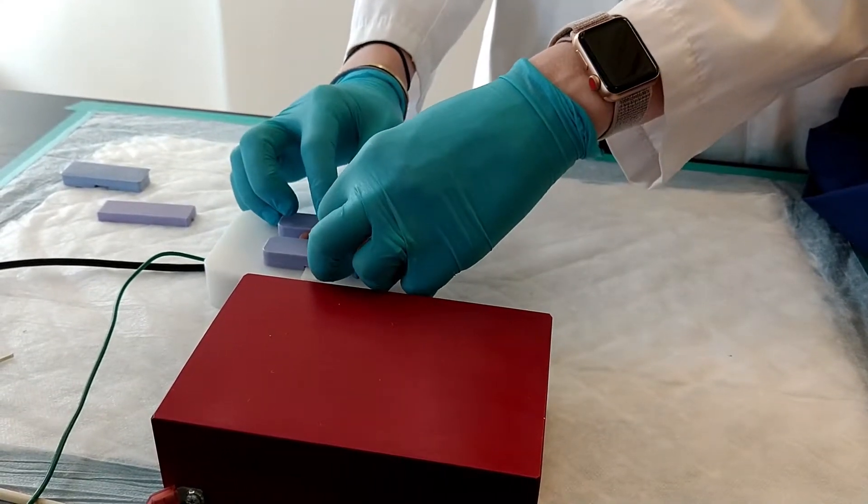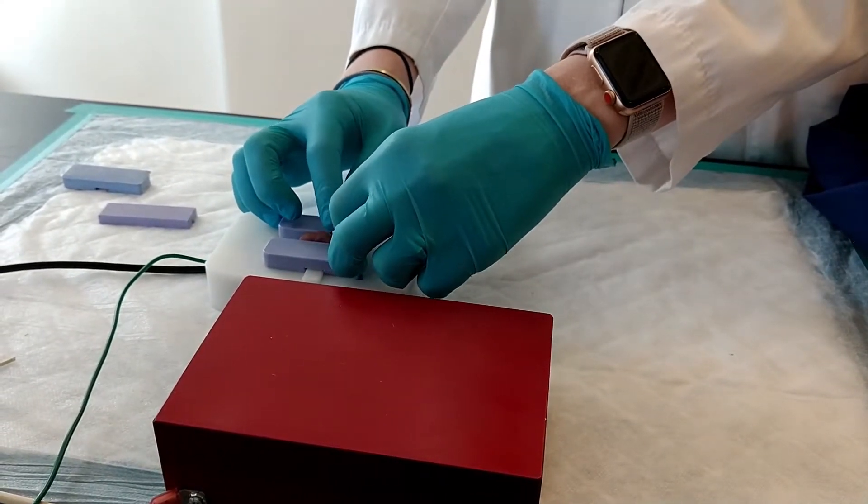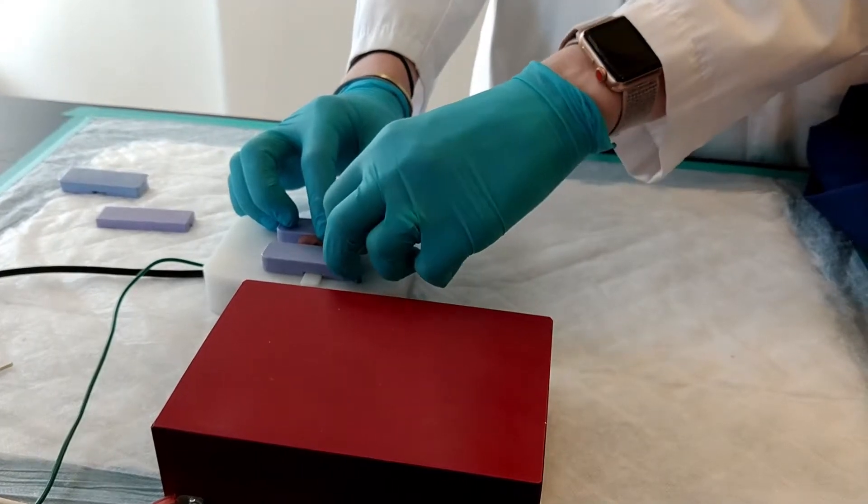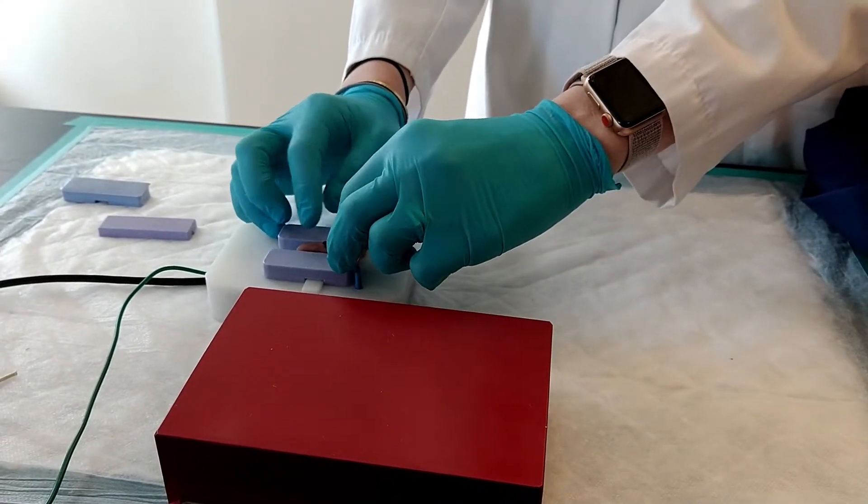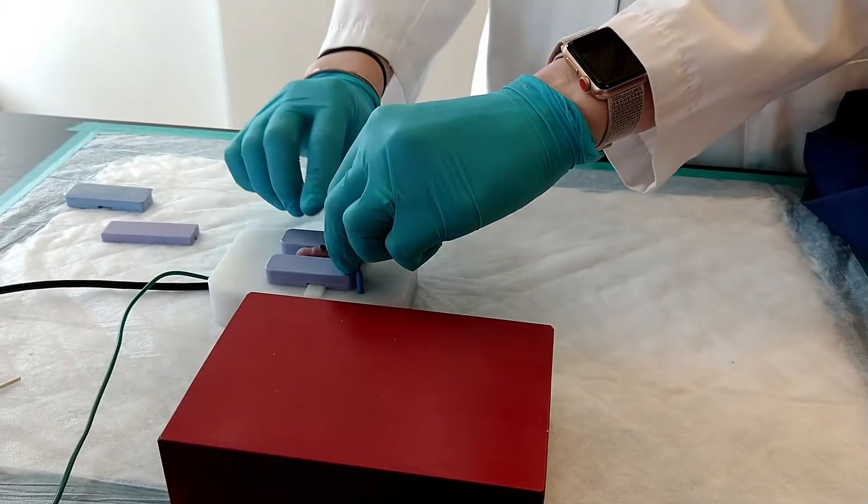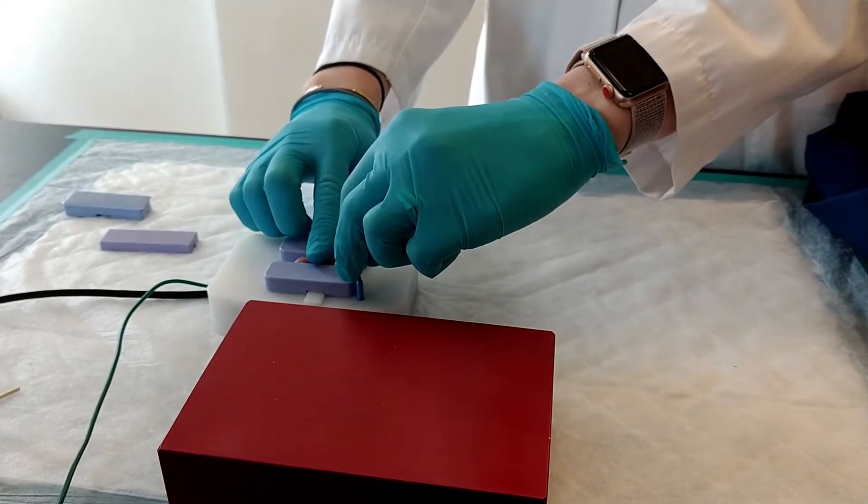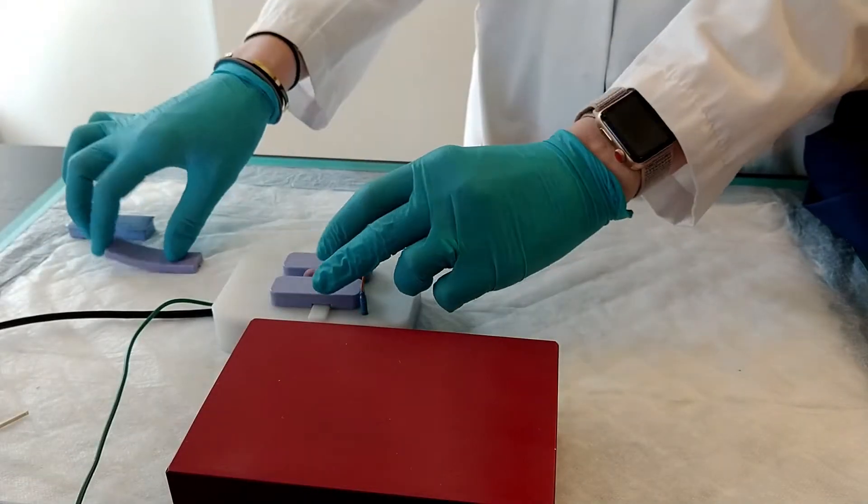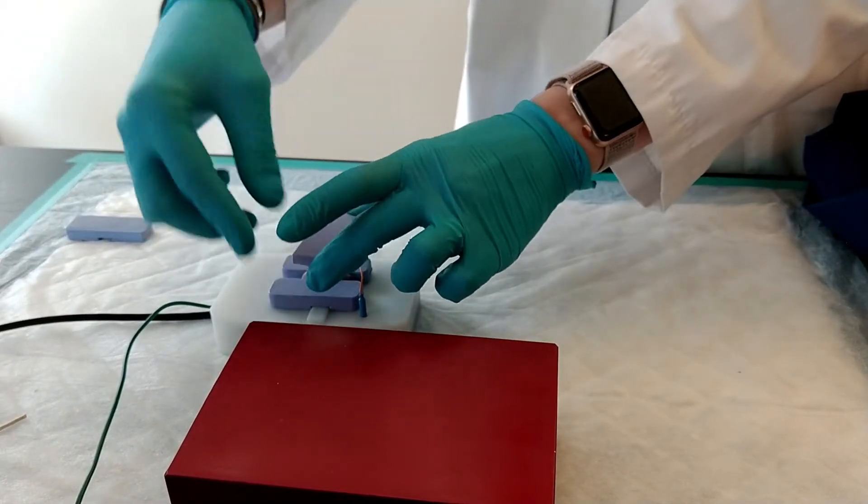Put the back electrode on and use another piece to keep that in place.